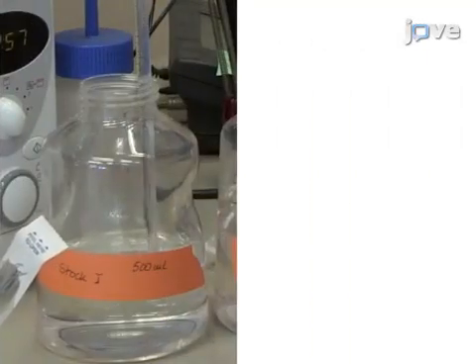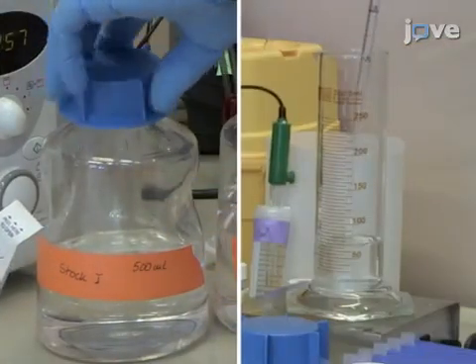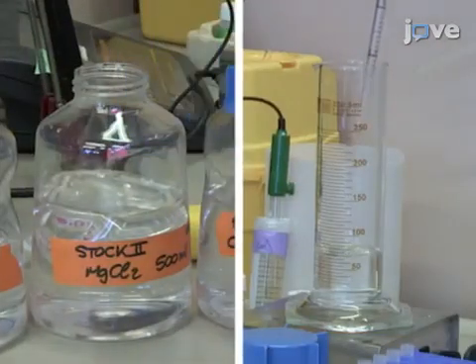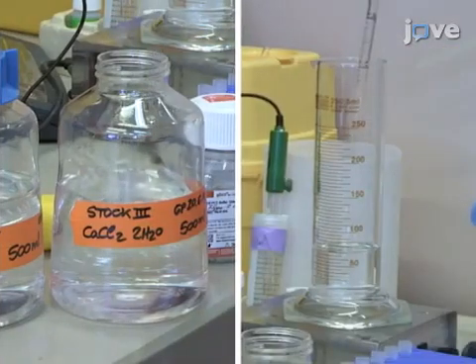Finally, add 5 mL of stock solution 1, 1 mL of stock solution 2, and 2 mL of stock solution 3.